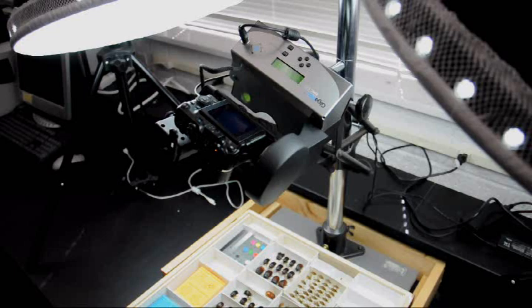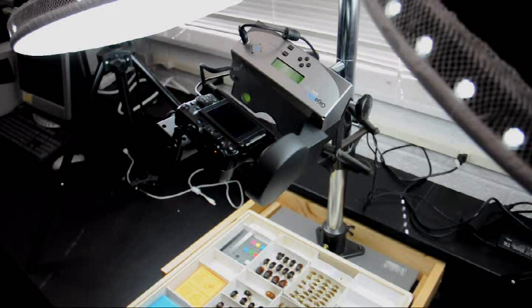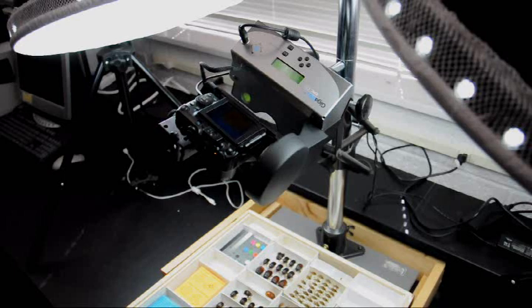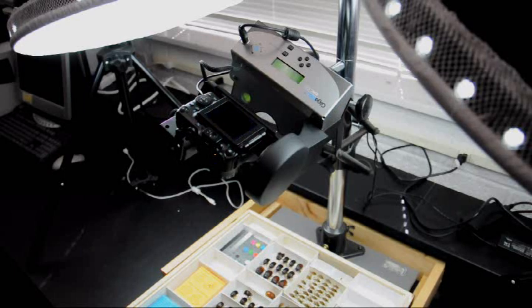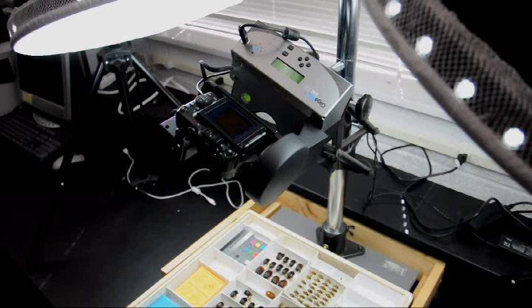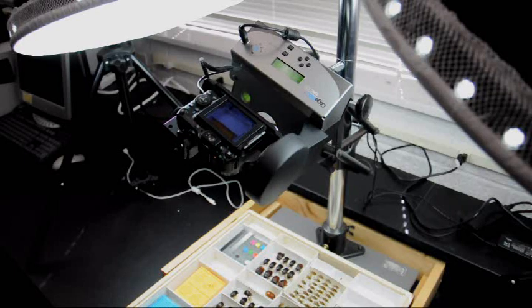One key thing to remember is that if multiple drawers are going to be shot, it is necessary not to move the unit after it is done. This is because the robot uses the final position to calculate the start position, and deviations lead to incorrect panoramas.